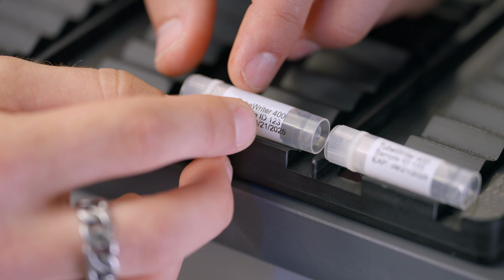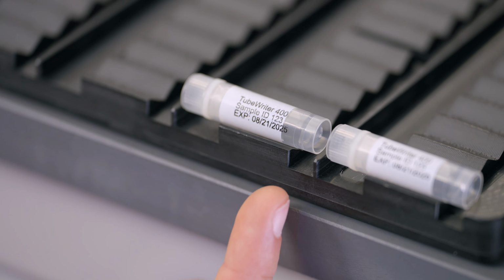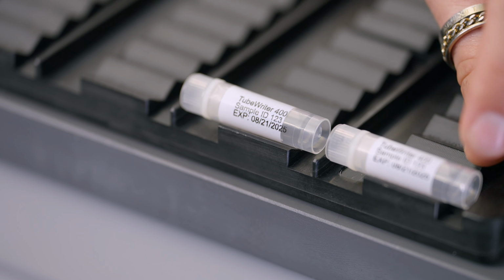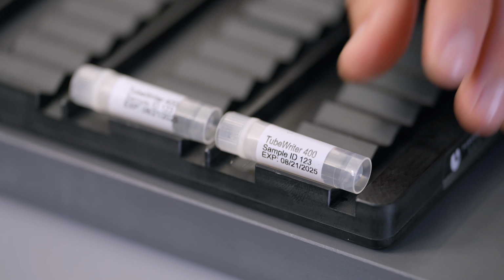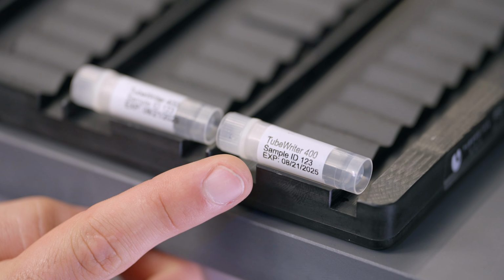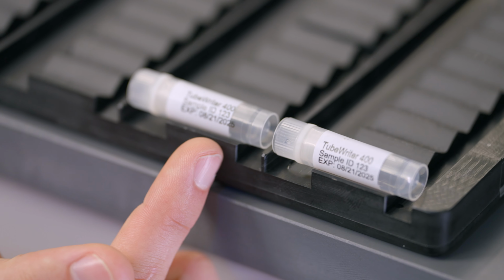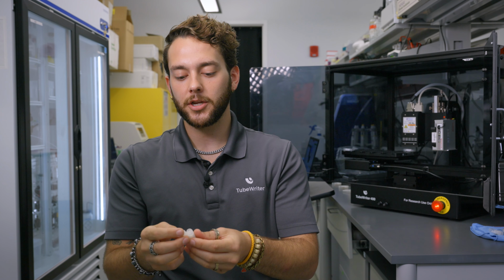The first print I did had the text off of the white patch, so I needed to move the text over a bit. So I went into the software, made some adjustments with the directional arrow keys, and you'll see that now the entire text is on the white patch and no longer off of the white patch like it was on the first print run. That's one way you can move the print location.